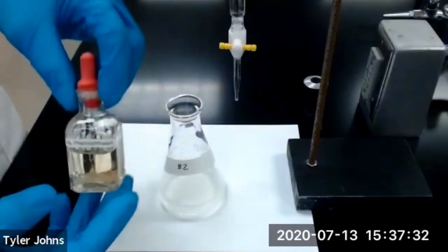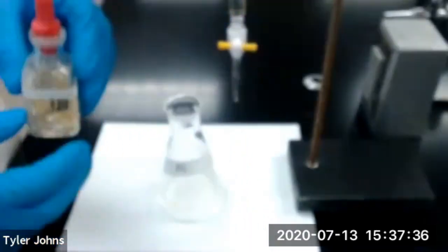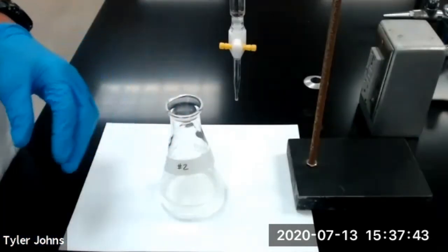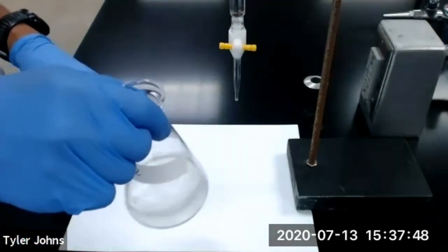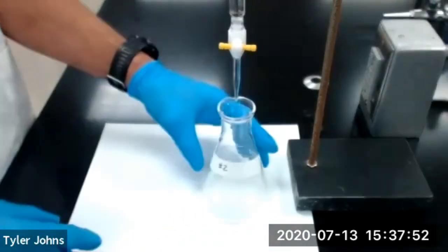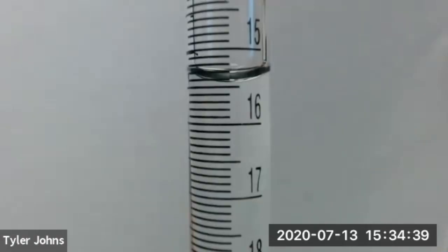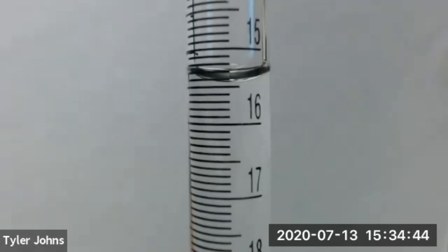We will now add three drops of our 1% phenolphthalein indicator to our second flask, which contains the second half of our vitamin C tablet, and we'll swirl to mix. We're now ready to begin titration for the second half of our vitamin C tablet, or titration number two. This is the initial burette reading for the titration of the second half of our vitamin C tablet, or titration number two.